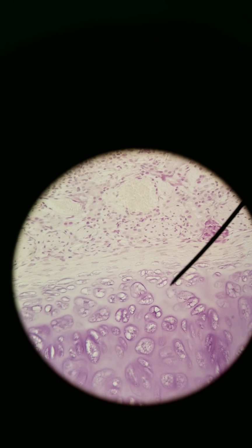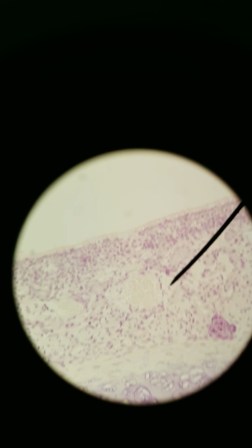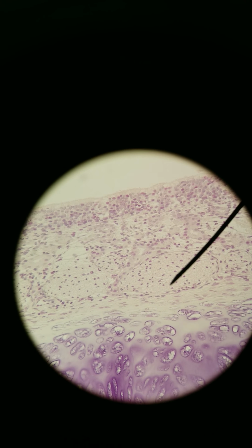You've got your axons bundled deeper in. So you've got bundles of axons like over here. And then that goes through the ethmoid, the olfactory foramina, the cribriform plate, up to the olfactory bulb. And from the olfactory bulb, we've got another neuron extending through the olfactory tract to the olfactory cortex.